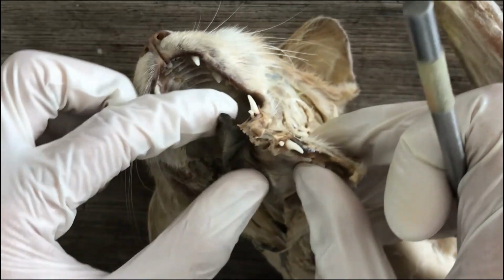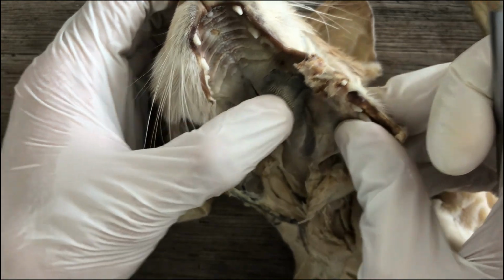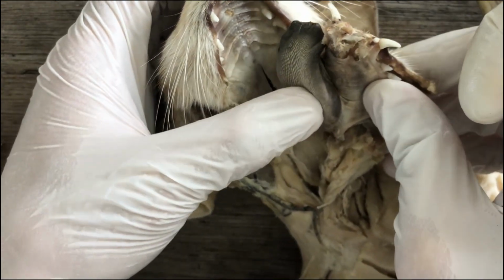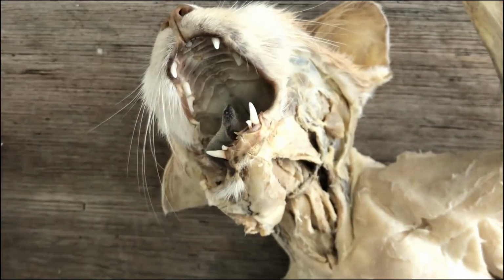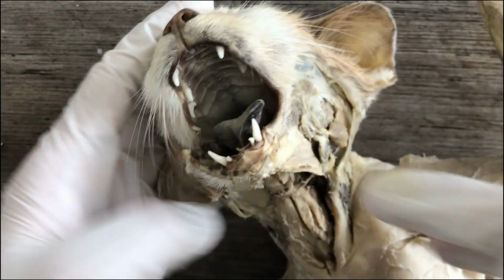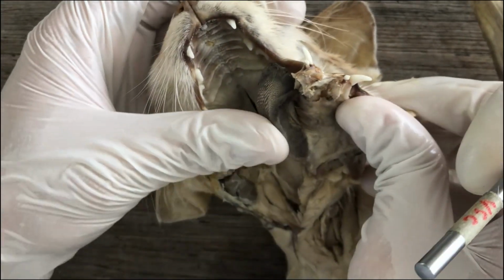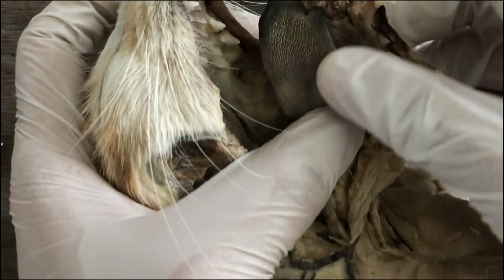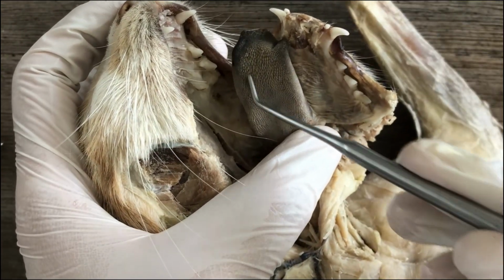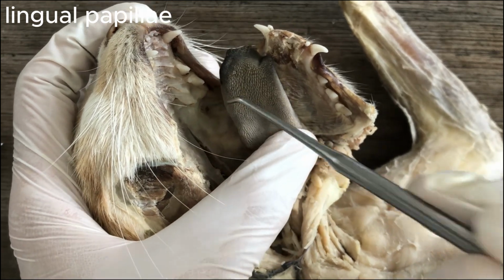And what else? In some cases, it's also secretory, so may mga secretory cells in the tongue. For example, mucus secretions. So it's mobile, it has muscles, and it's sensory. Those are some of the unique features ng definitive tongue of the cat. When you look at the dorsal portion of the tongue ng cat, there are minute structures there called papillae. And there are different types of papillae in a cat.